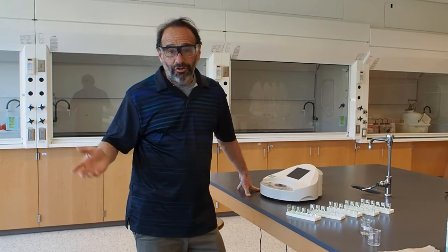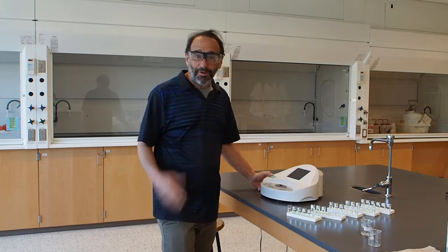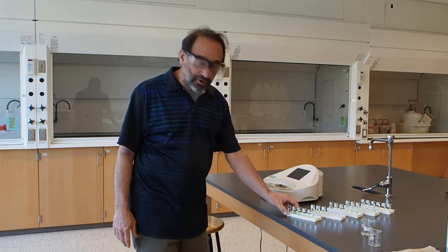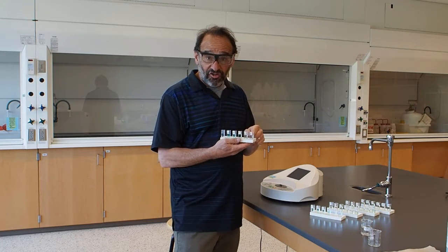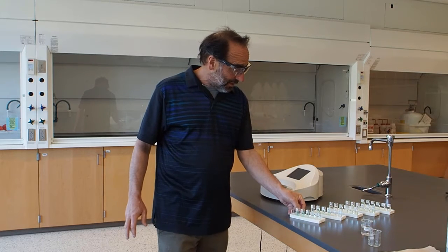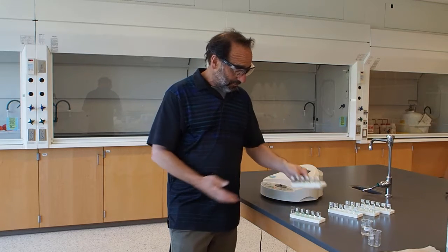Okay, so we're ready now to do the experiment. We're ready to make our measurements. We're going to be using the PerkinElmer Lambda spectrometer, which is a diode array spectrometer. We're going to set that to the wavelength at which we have the maximum absorbance for the nickel nitrate, and look at our samples. First, we're going to do our blank and our 5 known concentration standard samples, and then we'll make a standard curve. After that, we'll analyze all 24 of our unknown samples. So it's time to make the measurements.